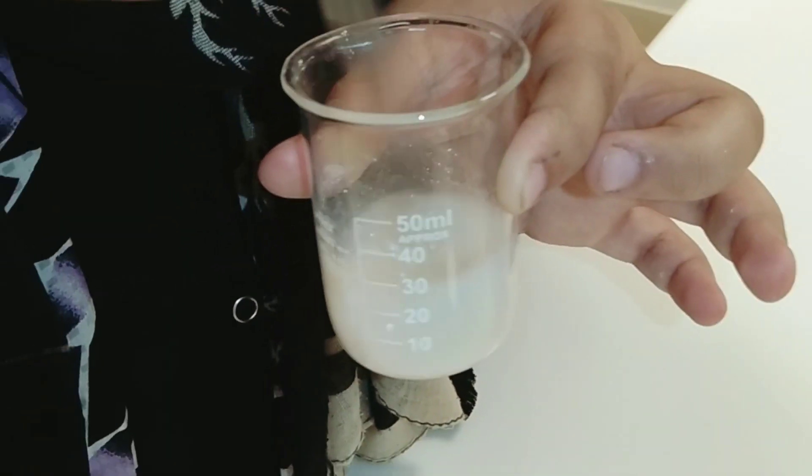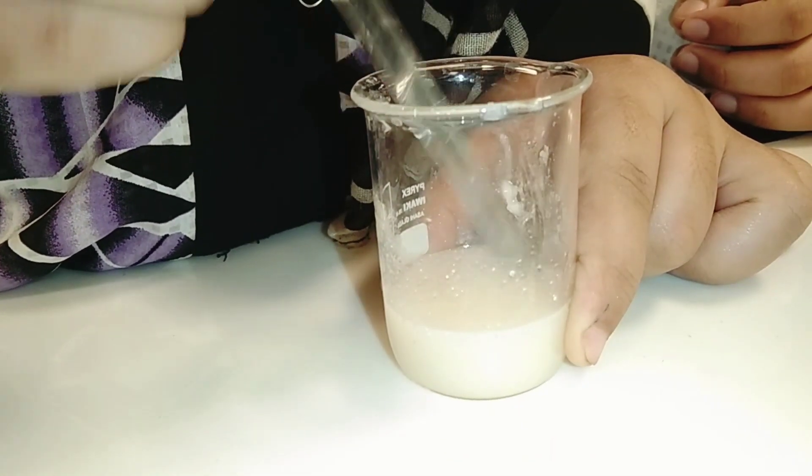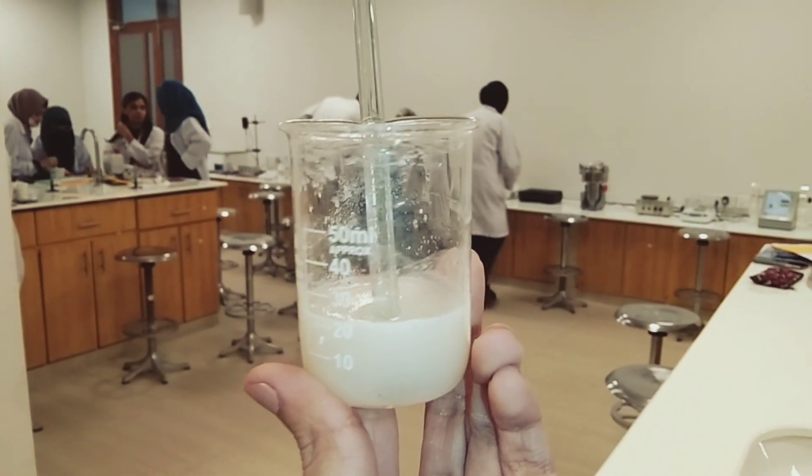We will keep it dissolving and use purified water to make up the volume. Finally, we have prepared 20 ml of orange syrup. I hope you like it.